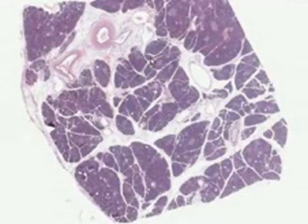All these little blue areas separated by thin amounts of connective tissue are called lobules. Notice here's a big lobule, here's a somewhat smaller lobule, here's a real big lobule, and there's probably a very tiny lobule there.